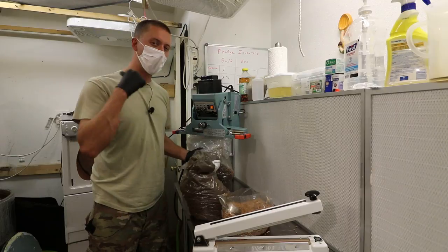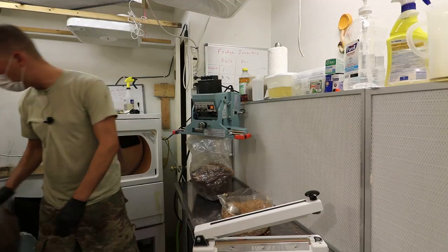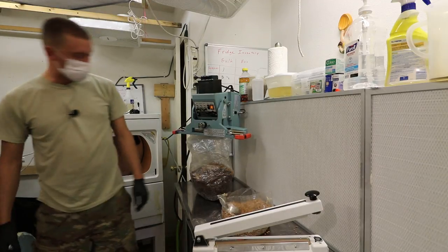Another thing — you don't want to let the bag tumble too long, because sometimes it rips the seal. It just keeps tumbling and tumbling and it'll crack it open.